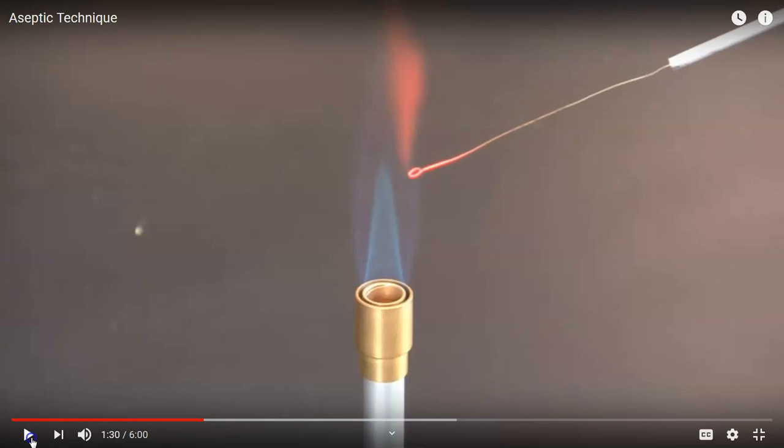Notice that as he sterilized the inoculating loop, he allowed each part of the metal on the loop to glow kind of an orangish yellow, maybe a reddish orange. That is essential and very important. If you don't allow the loop to glow like that, you won't kill all the bacteria that might be on the loop. There are some bacterial cells called endospores that are extremely heat resistant, and it's only when you get temperatures hot enough to turn the loop that yellowish orange that you can kill those endospores.